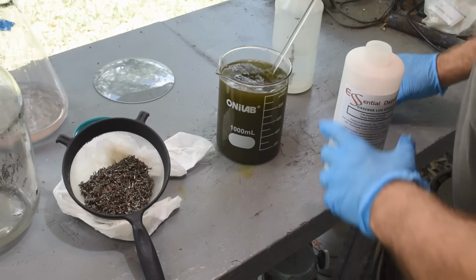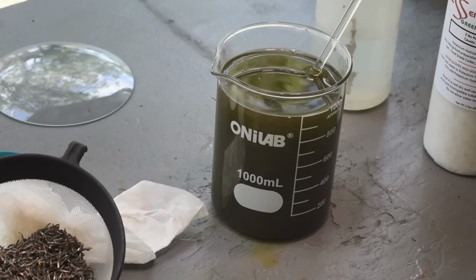Let me find my pH paper and test it and see if we have the pH up high enough or I need to put more stuff in. So I would say we did dissolve some copper since it's turning green here. Where are we? Oh, we are maybe only about 11. I'll put a little bit more in just to make sure we get all of the metal hydroxides to crash out of solution.